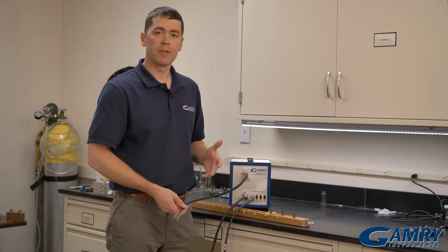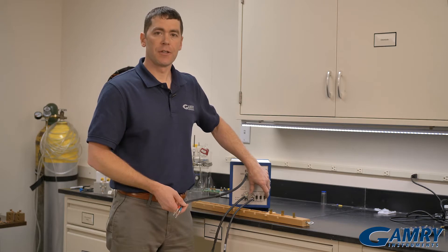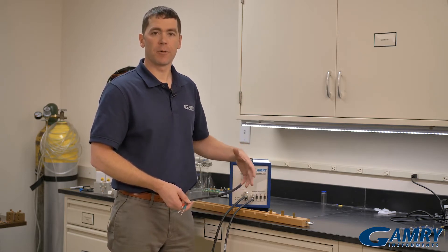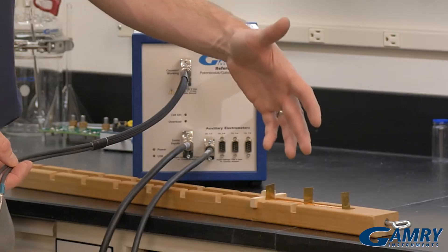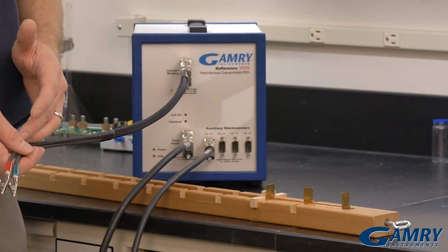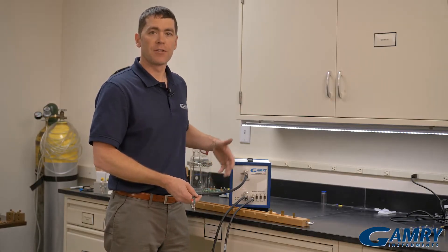The auxiliary electrometer is a useful feature. It's eight additional voltage measurement channels that this instrument has, which can measure 0 to 5 volts anywhere within the compliance range. In this particular instance we're going to hook it up to two 18650s at the same time. I could do this with several cells as long as they fall within the compliance range of the instrument.